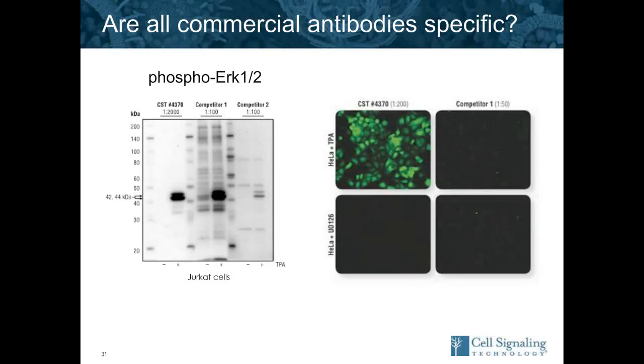In the Western blot on the left, you can see the CST antibody, and then two competitor antibodies. Note all the non-specific bands. When we look at the IF images on the right, competitor number two in this case was not validated for IF, so we didn't feel it was fair to test that. But competitor one was validated for IF, so we tested that. And you can clearly see with the CST antibody, the on and off in treated or inhibited. And in the competitor antibody, it's just dim stain in both conditions.